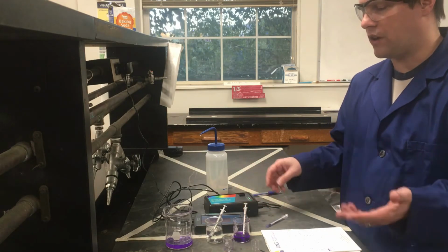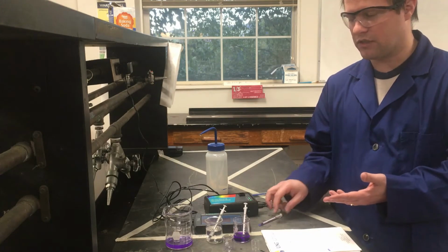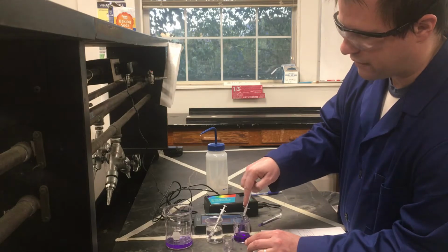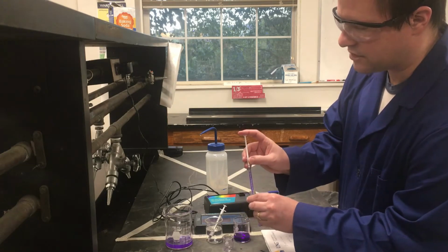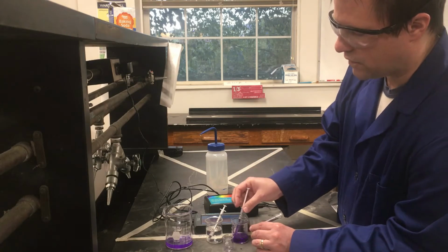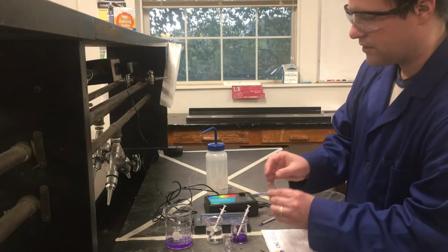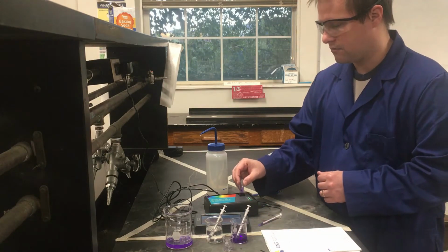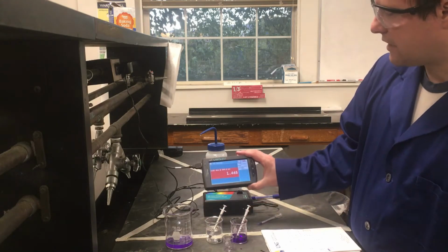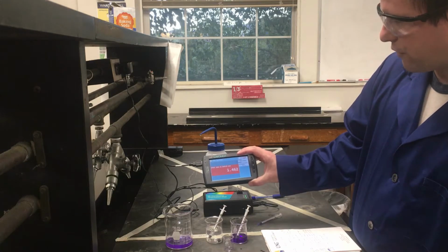And so the first one that I'm going to start with is the most concentrated. So basically I'm just using my actual stock solution here. I'm just going to take some of our stock solution that we created for part 1 and add this to our cuvette. And we're going to measure this thing's absorbance to see what the absorbance is at our lambda max approximately. If I add this to my spectrophotometer and measure our absorbance, I'm getting something right about 1.4, looks like about 1.45 something.